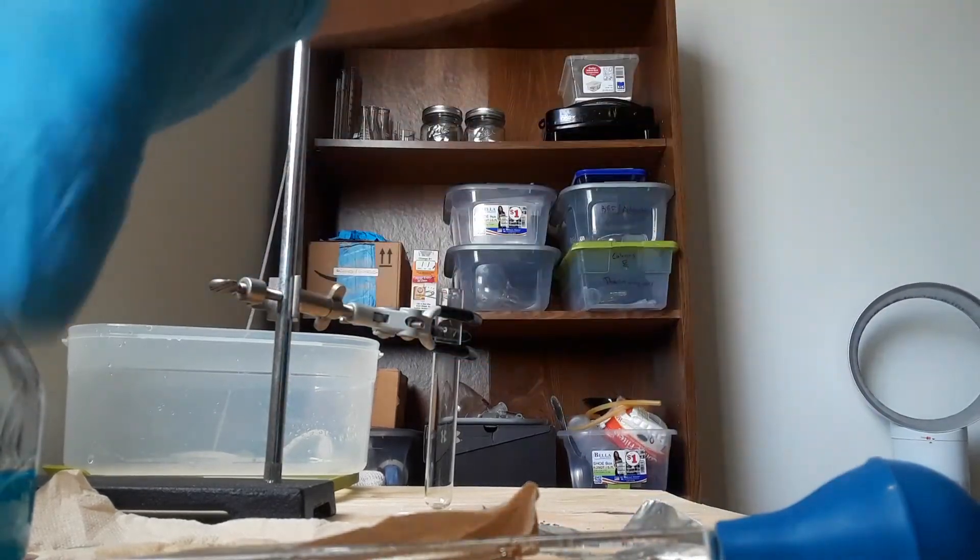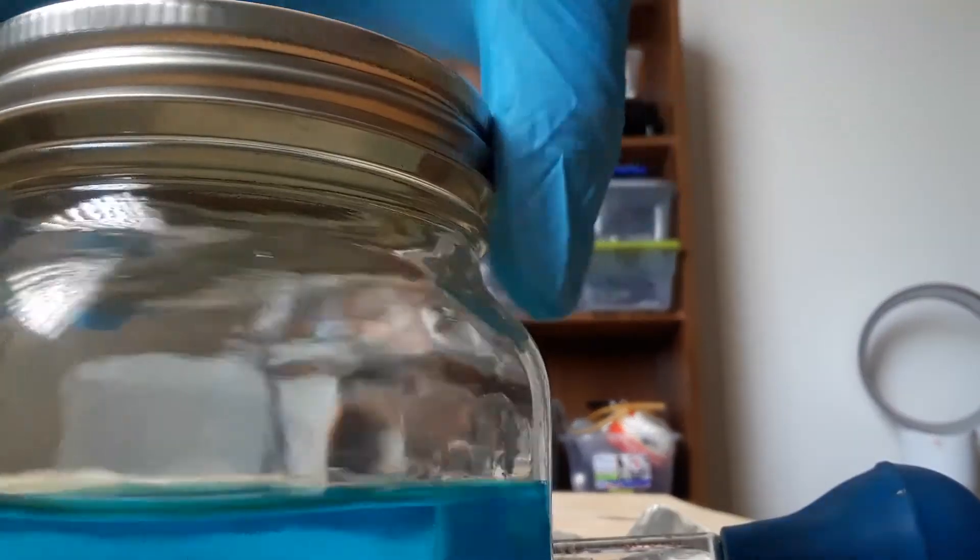Alright, so I have a solution of copper and zinc sulfate which took me quite a while to actually get to this concentration.